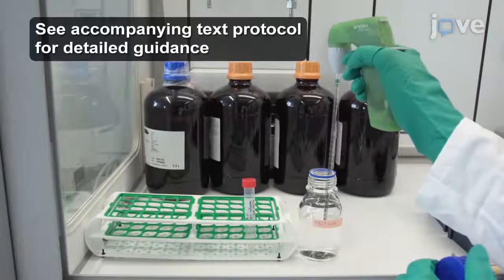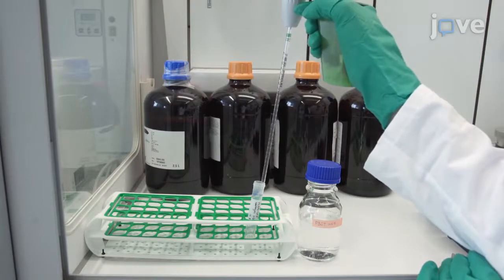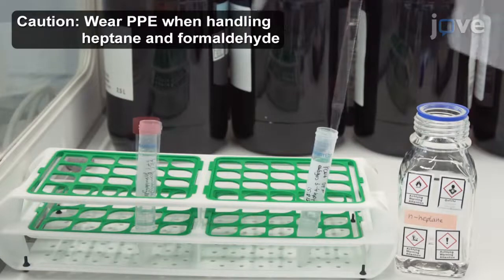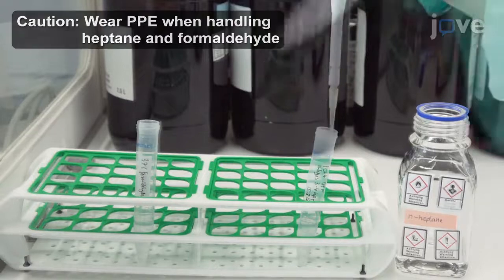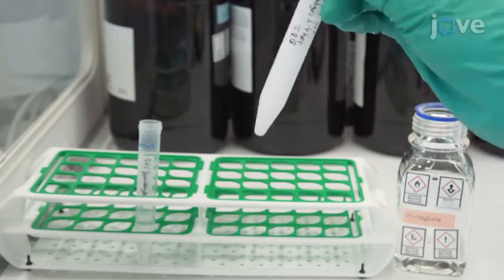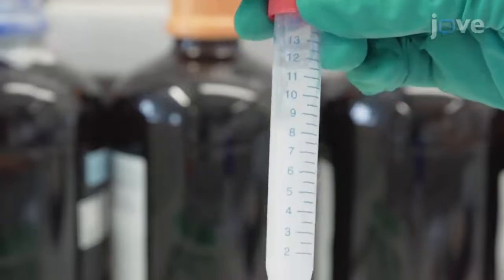To begin the protocol, adjust the total volume of previously collected embryos to 2 milliliters with PBST. Add 6 milliliters of heptane and 100 microliters of 37% formaldehyde in water. After adding formaldehyde, vigorously shake the tube up and down for 1 minute. The aqueous and organic phase will combine to form a shampoo-like consistency.